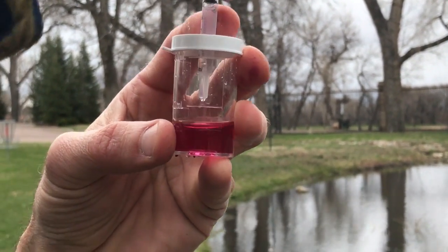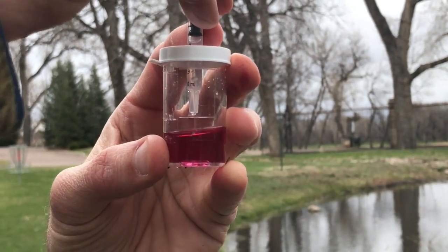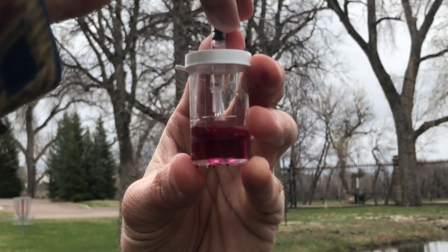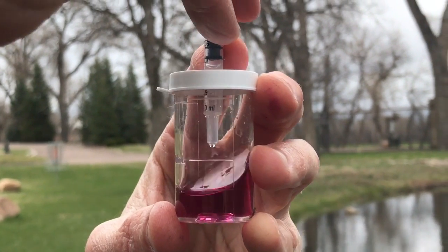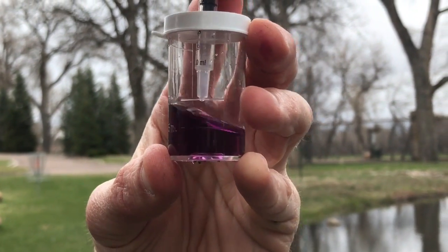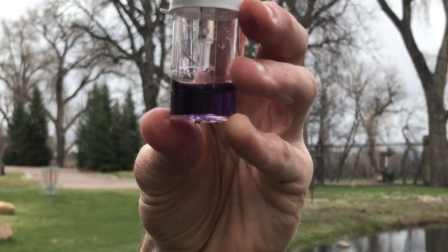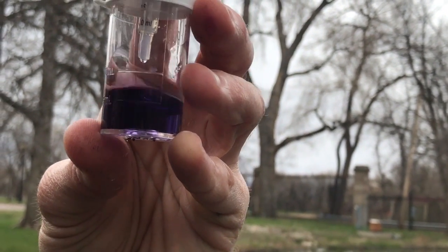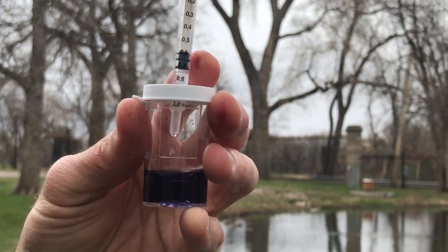Okay, it should be going here pretty soon. We're past our numbers for calcium, so it's got a fair amount of magnesium in addition to the calcium. Okay, we might be starting to see our first purplish thing here coming up. Getting a little bit darker hue. Okay, there's the purple. And is it going all the way blue? Let's see. It is really close. Probably one more drop. There we go. There's our blue.